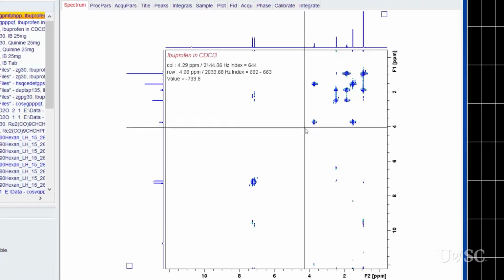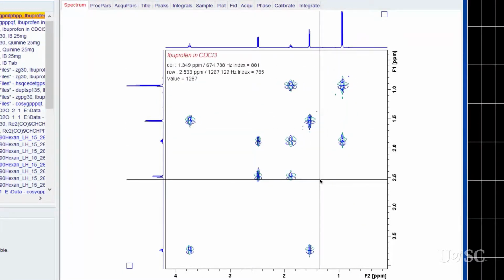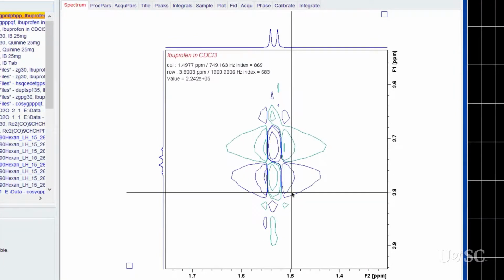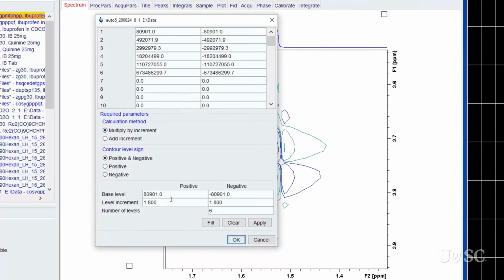The peaks in the aliphatic region are all spaced apart, so overlap is not an issue. Closely examining a cross peak, it is clear that it is a cluster of peaks with different phase. The green contours are opposite of the blue peaks. Therefore, half the peaks are pointing in a different direction than the other. Like the magnitude experiment, the default contour spacing and number should be adjusted. The tighter contours clearly distinguish these antiphase peaks.